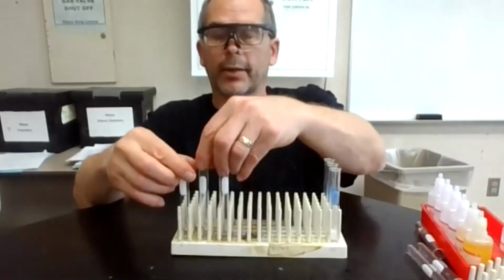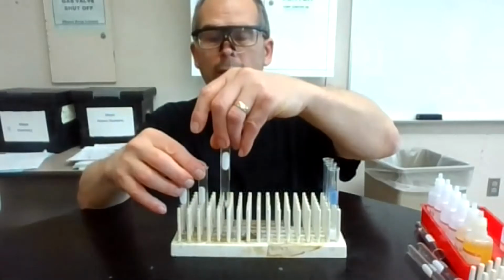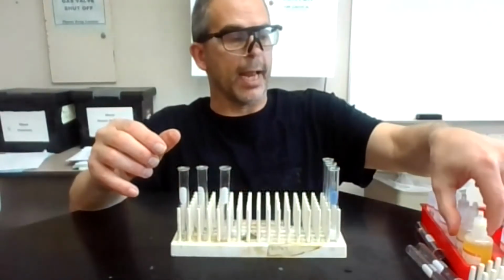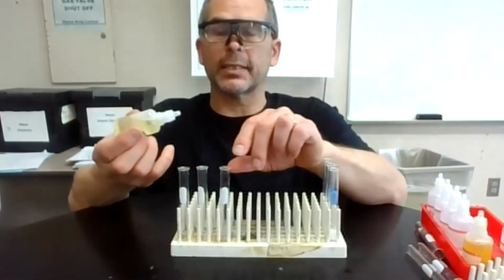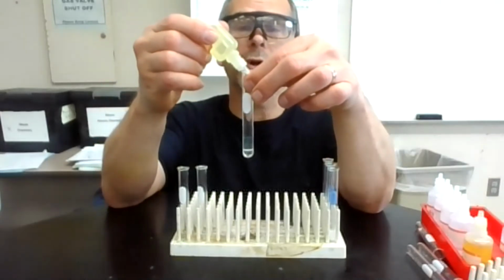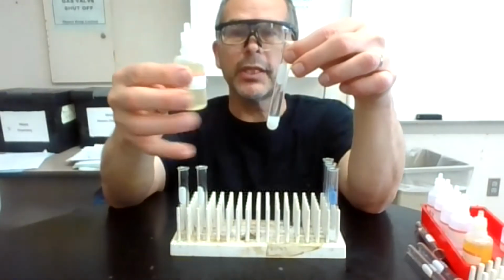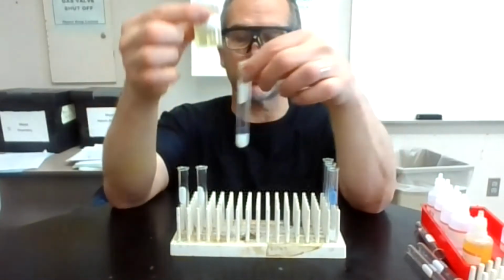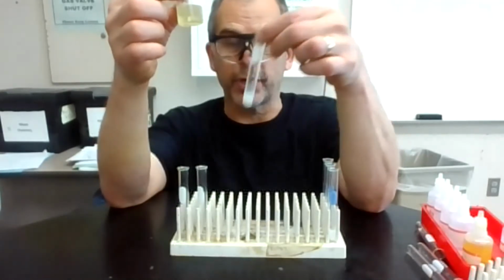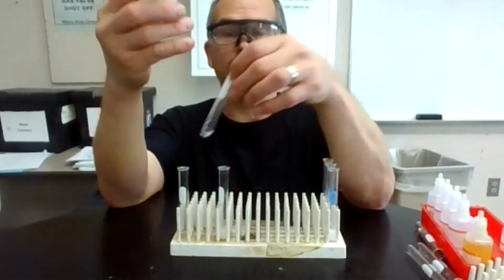Okay, and I look and I got 3 clear solutions again, which is what I'd expect. And then what I'm going to do this time is add this FeCN6 minus 4 into the first solution, which is a silver. 1, 2, 3, 4, 5, 6, 7, 8, 9, 10. So it looks cloudy again, a little dingy yellow. Now I could centrifuge if I needed to, but there's some definite cloudiness there.